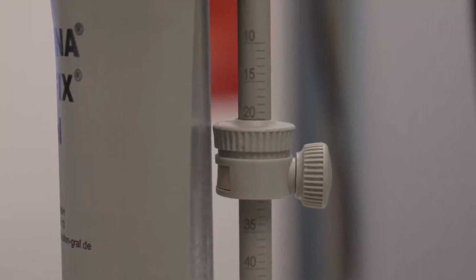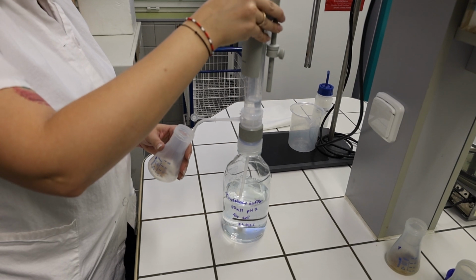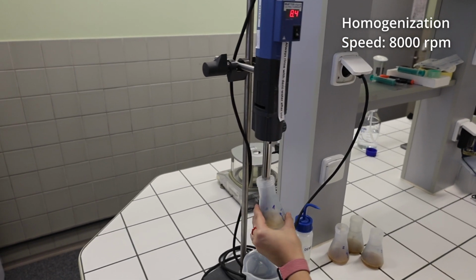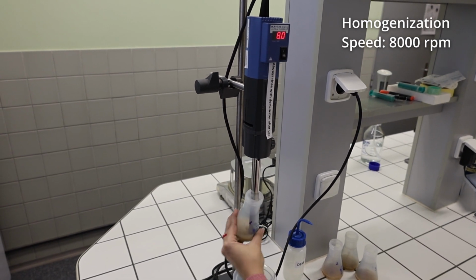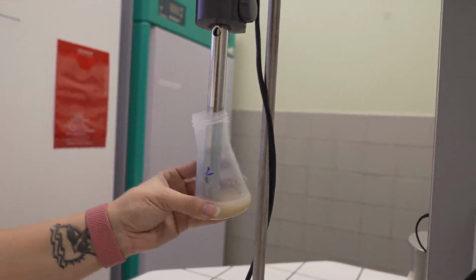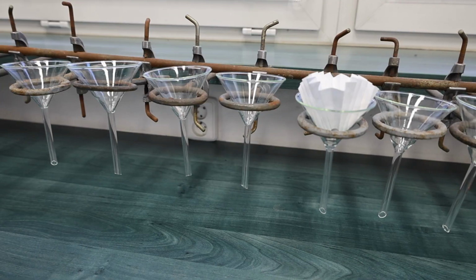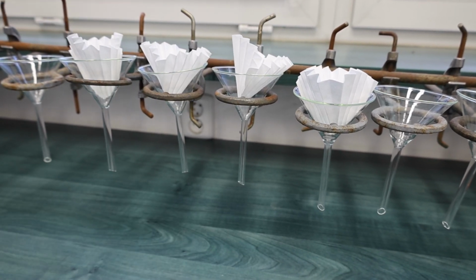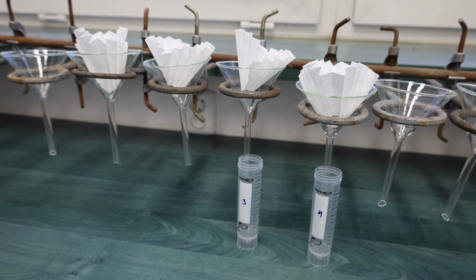When the sample is weighed, 20 ml of the 50 millimole phosphate buffer is added, and the mixture is briefly homogenized using the high-speed batch homogenizer. The homogenizer must be washed using demineralized water after each sample to avoid cross-contamination. Right after homogenization, sample suspensions must be filtered through filter paper in order to remove solid particles and obtain a solution where enzymes are dissolved.